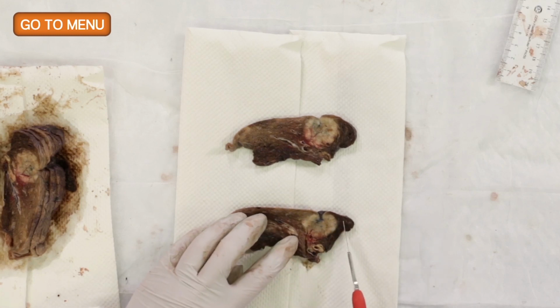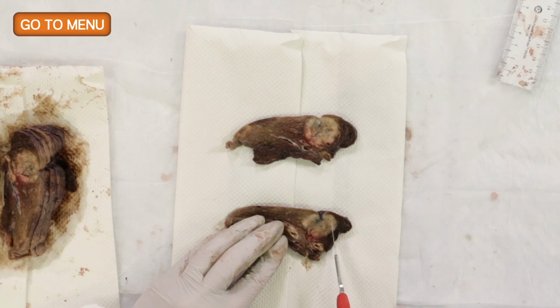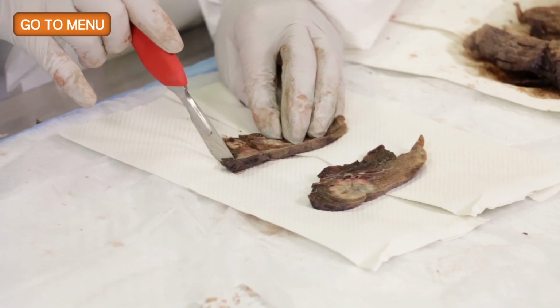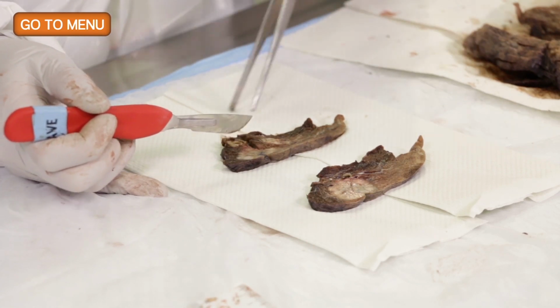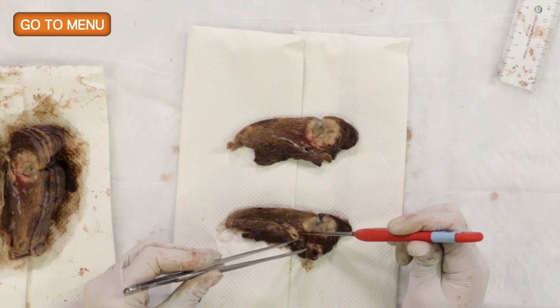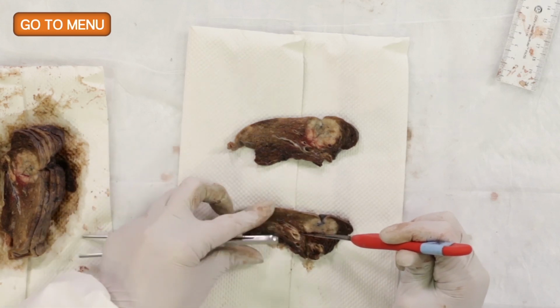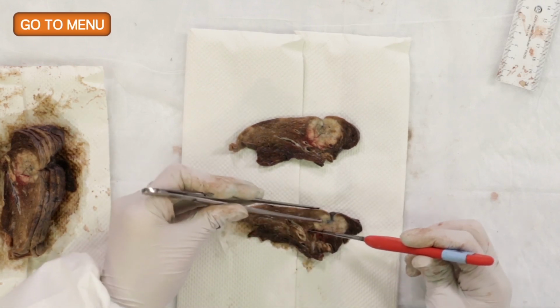And so a few words about sectioning while Esther is doing that. Our goal is to not make the sections too large because they will be difficult to fix in the tissue processing. And so some people use, say, a nickel. I think we tend to go a little bit bigger than a nickel. But certainly when we look at our histology cassette, the tissue should not be greater than 3/4 of the cassette.